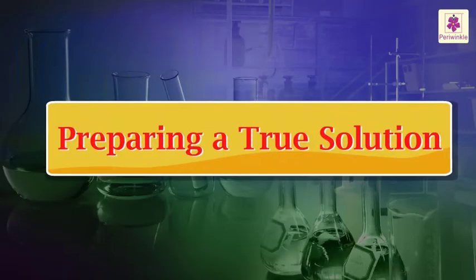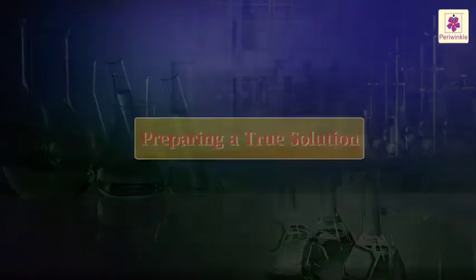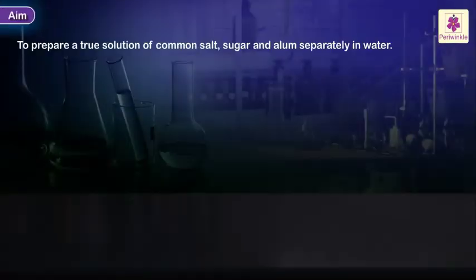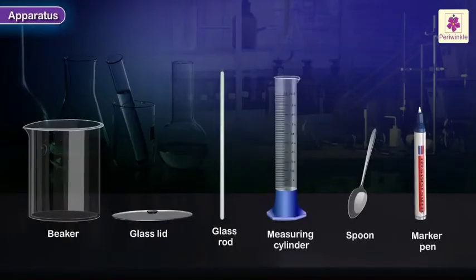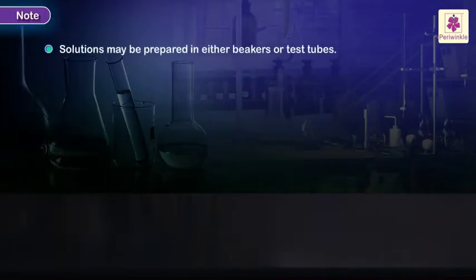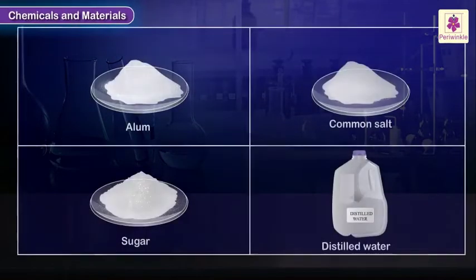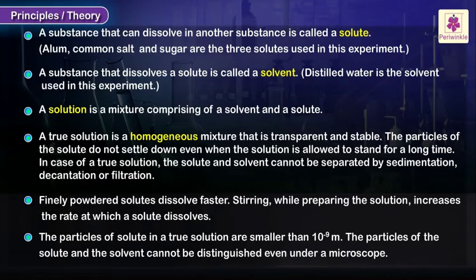Preparing a true solution. Aim: to prepare a true solution of common salt, sugar, and alum separately in water. Apparatus, chemicals and materials, principles or theory.